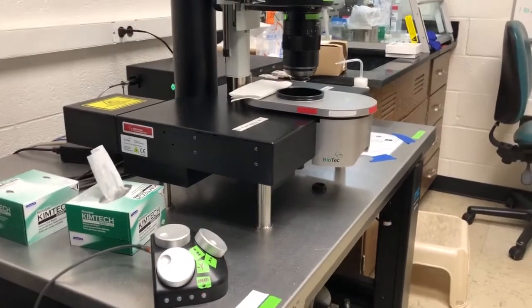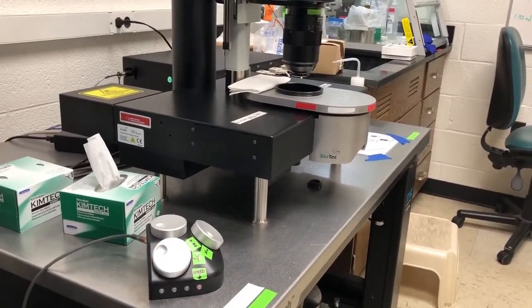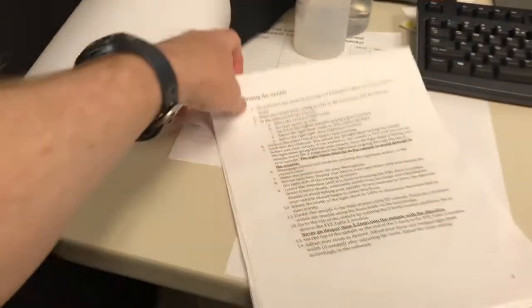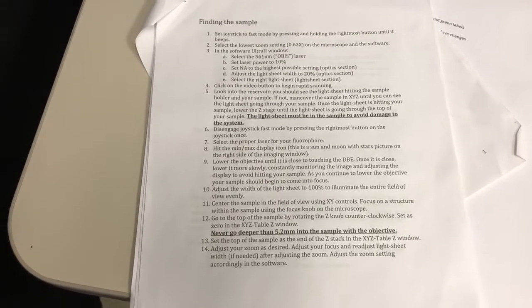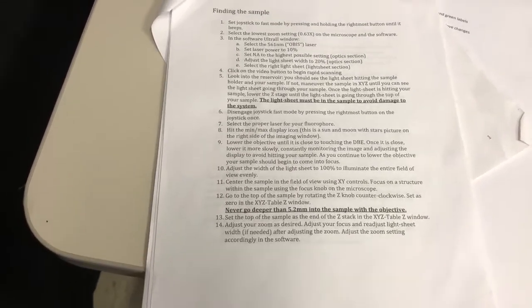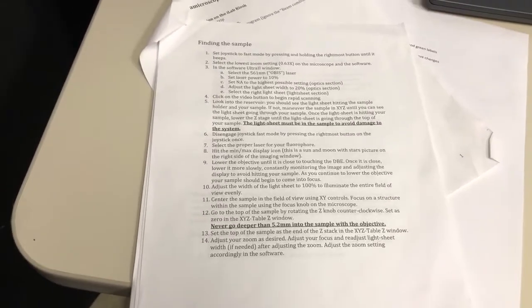Now that we've completed all the steps for mounting the first sample, what's next is the second page of the instructions, which covers finding the sample. You should be aware that the first two pages of the instructions need to be followed by the letter. You should do everything essentially exactly as they say, as we are going to do in a moment.